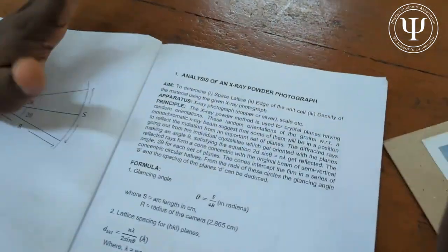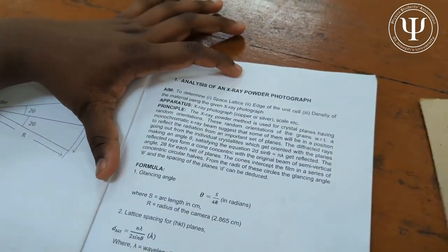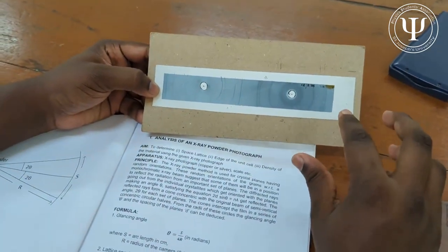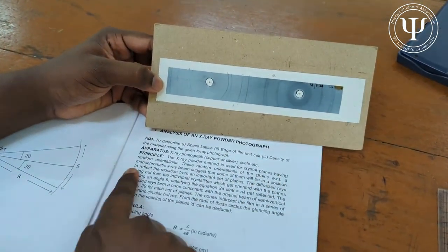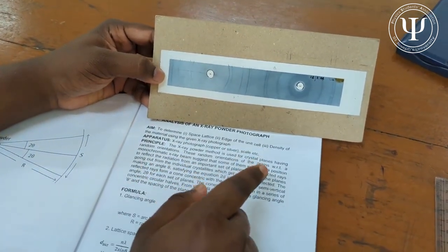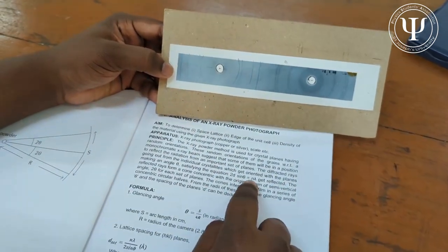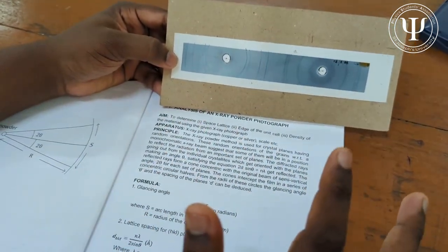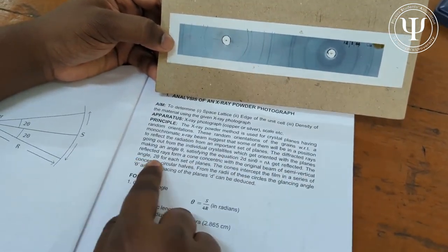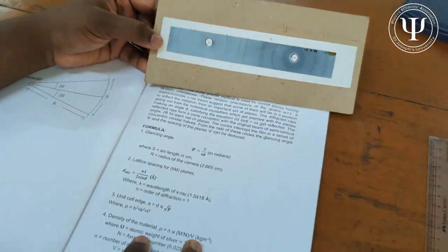The principle of this experiment is very simple. The x-ray powder method is used to find the random orientations of the planes. Using these random orientations, we can identify positions that reflect radiation from an important set of planes. Using the Bragg condition, we can find the interplanar distance, where the cone forms concentric beams of semi-vertical angles 2θ.